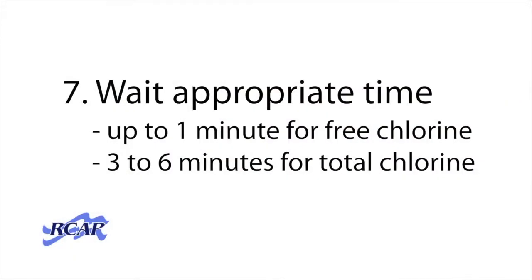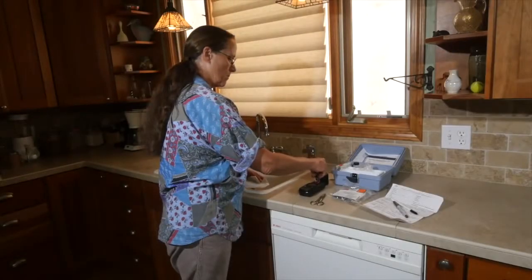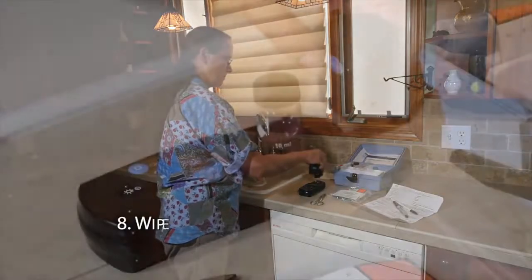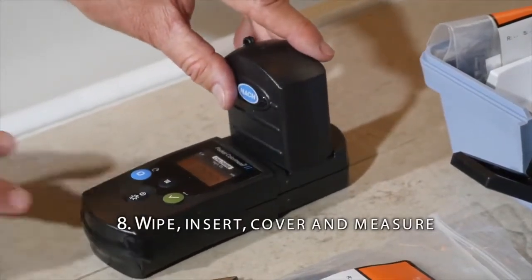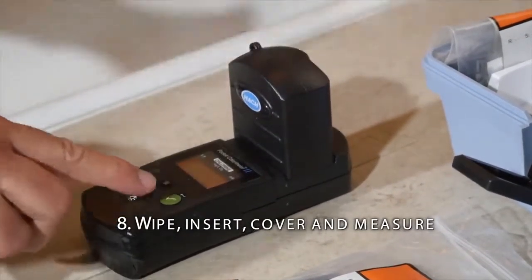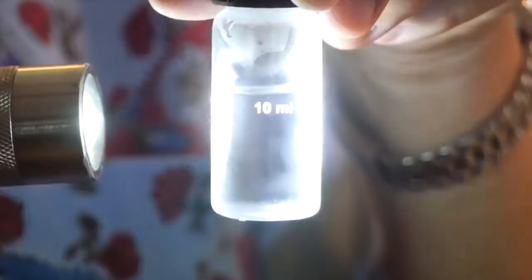For free chlorine, measure the sample within 1 minute. For total chlorine, you need to wait 3 to 6 minutes. Then the procedures are the same. To measure, wipe off the vial, line up the diamond, cover, and click Measure. Remember that fingerprints, air bubbles, and fog can change the result.